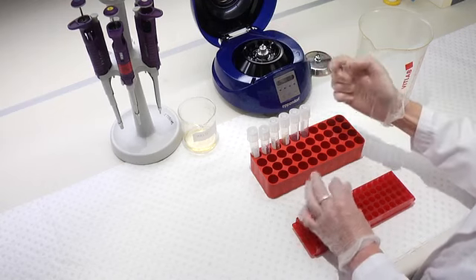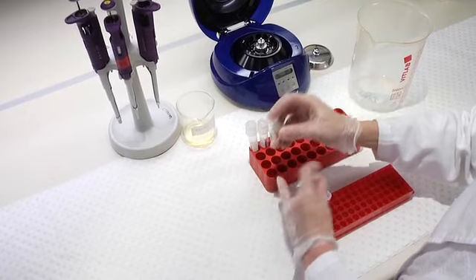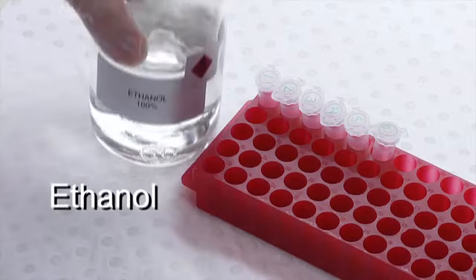And we can throw away the precipitate. And now, we need to separate the plasmid from all the leftover chemicals. And we'll do that by adding ethanol.